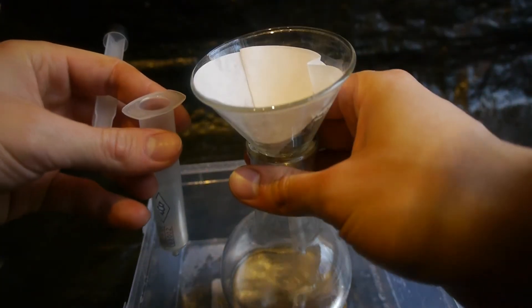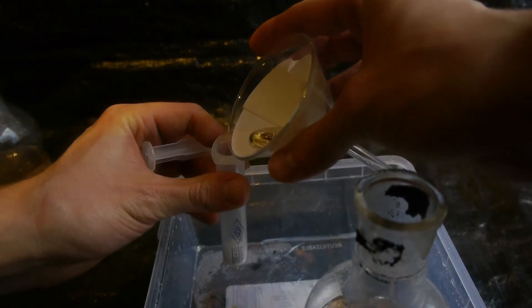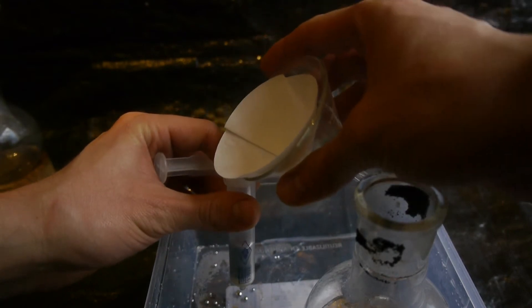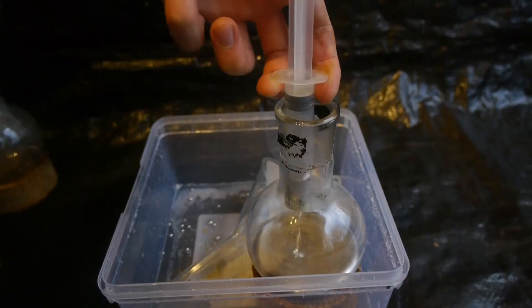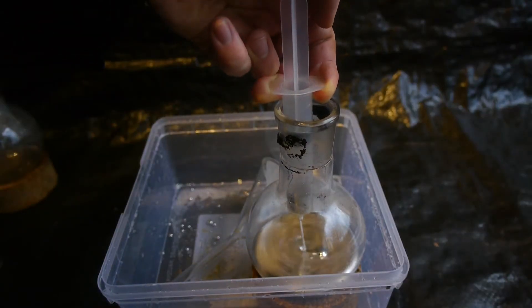Okay, that method is not going to cut it. So let's filter it through a syringe with some cotton. Where I can apply some pressure. Oops! Good that I had that bucket underneath. That's more like it. This is such a giant mess.